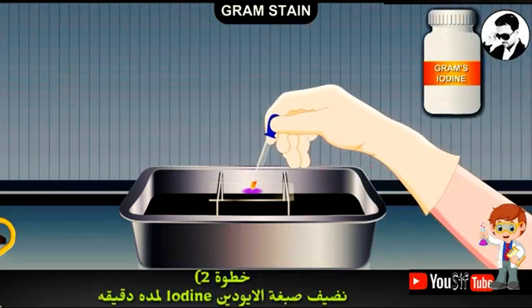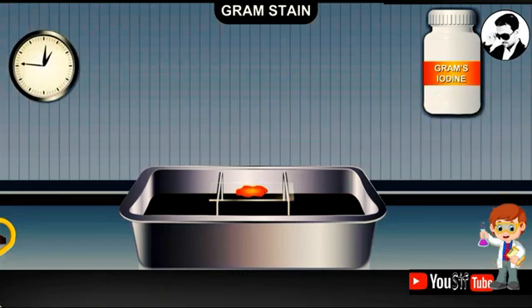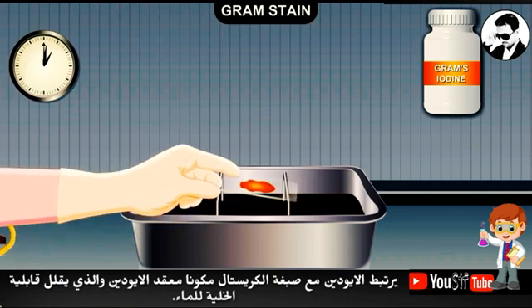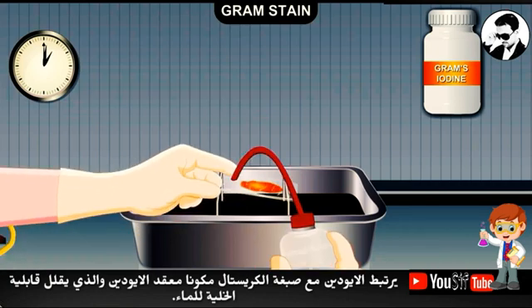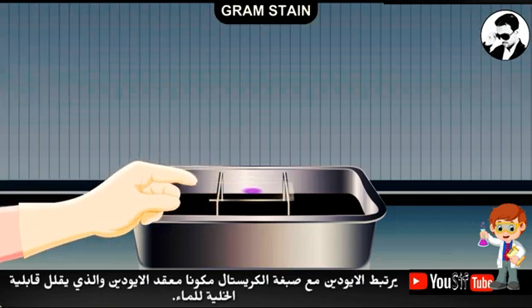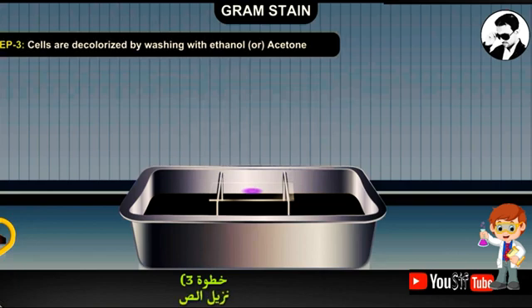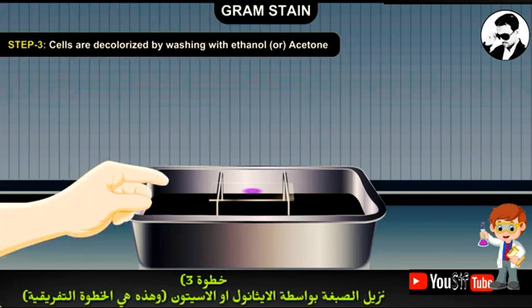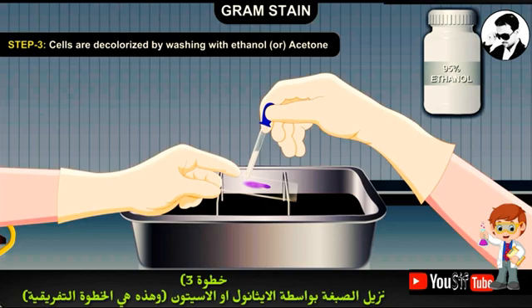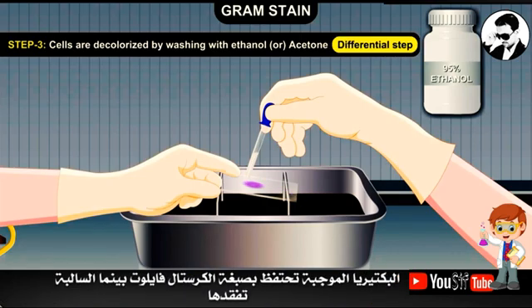Next, a solution of Gram's iodine is added and retained on the slide for about one minute. The iodine combines with the crystal violet to form a dye-iodine complex, thereby decreasing its solubility within the cell. At this point, the cells still appear purple.